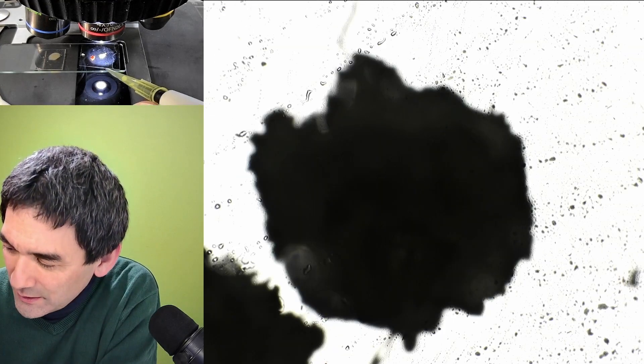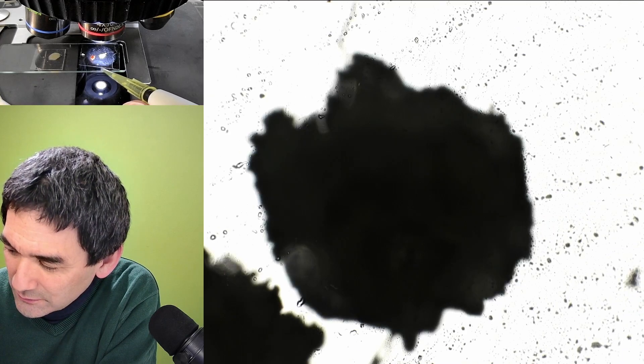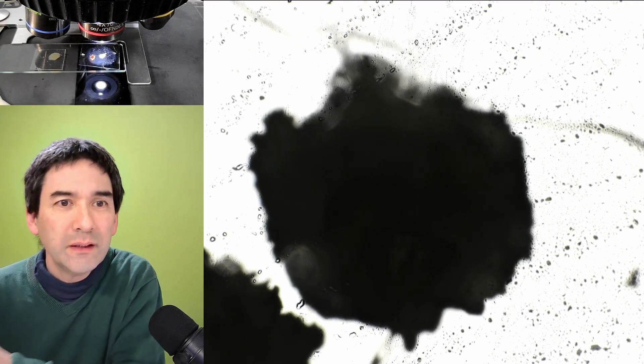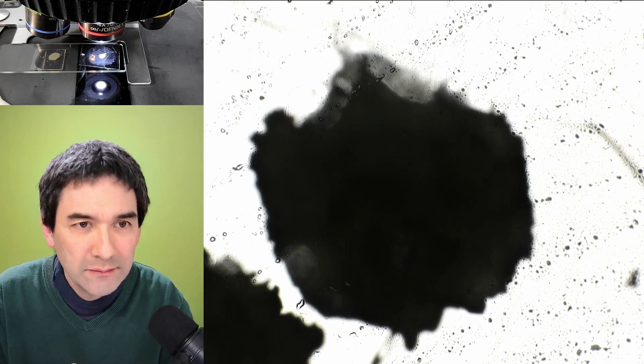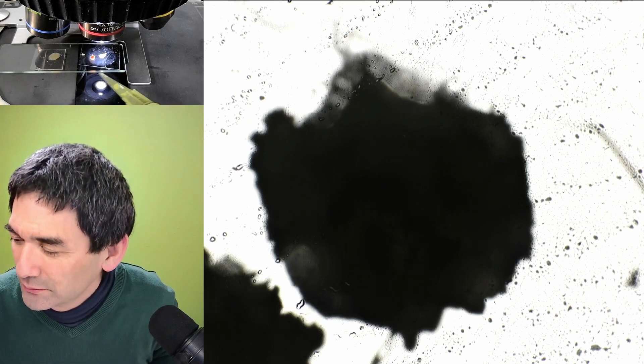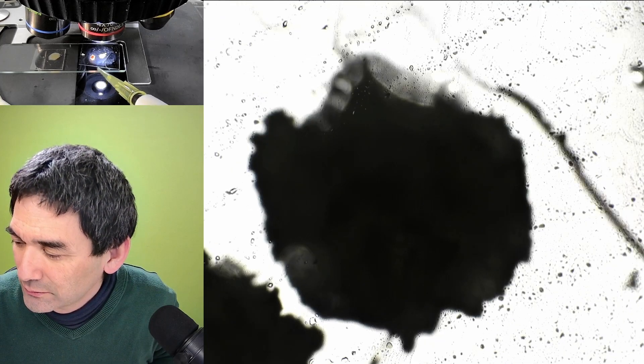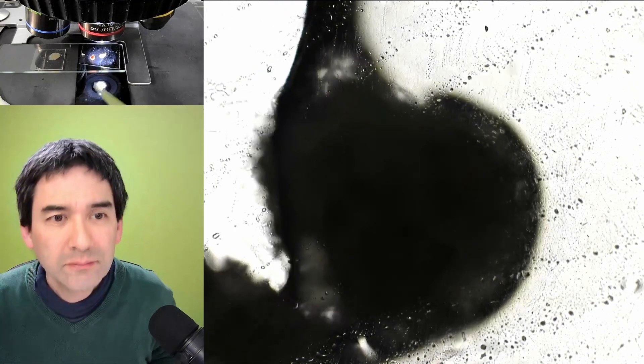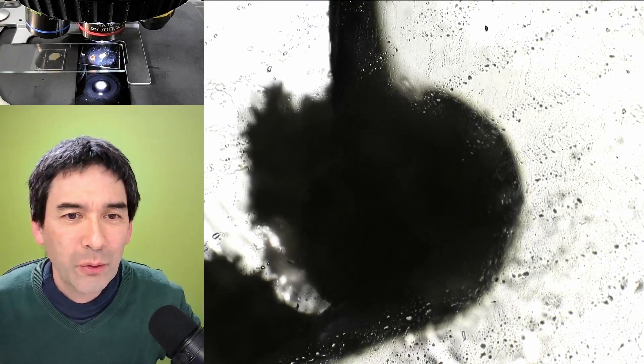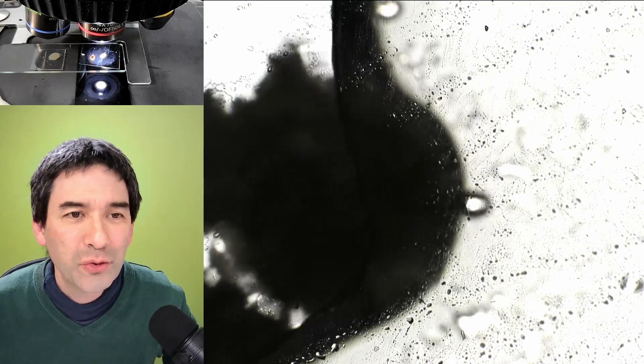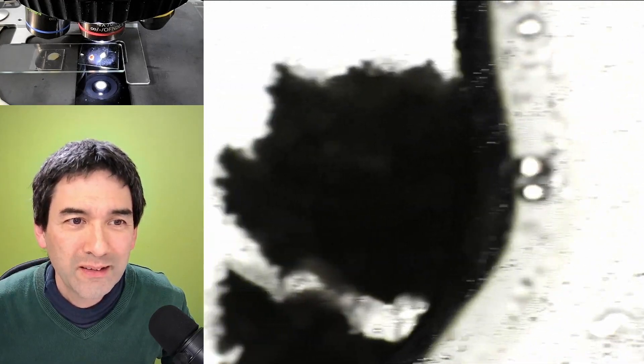Here we go. Let's give it a little try. Water is slowly approaching. Maybe a little bit more. And slowly the things start to dissolve as well.